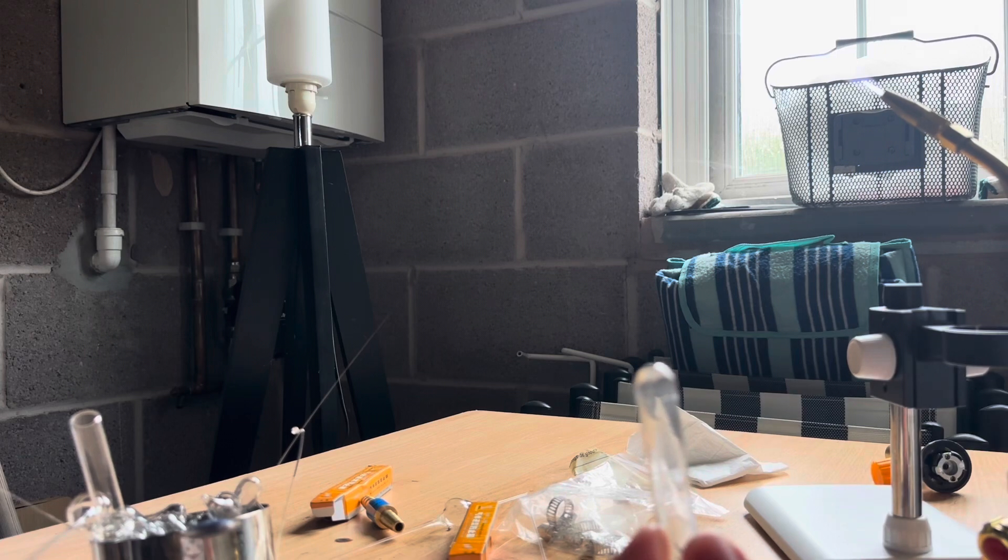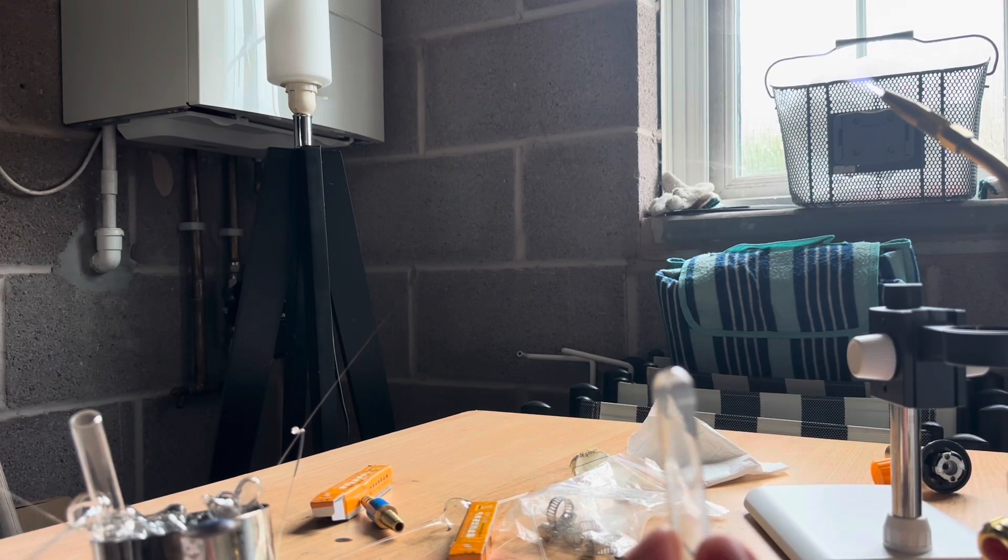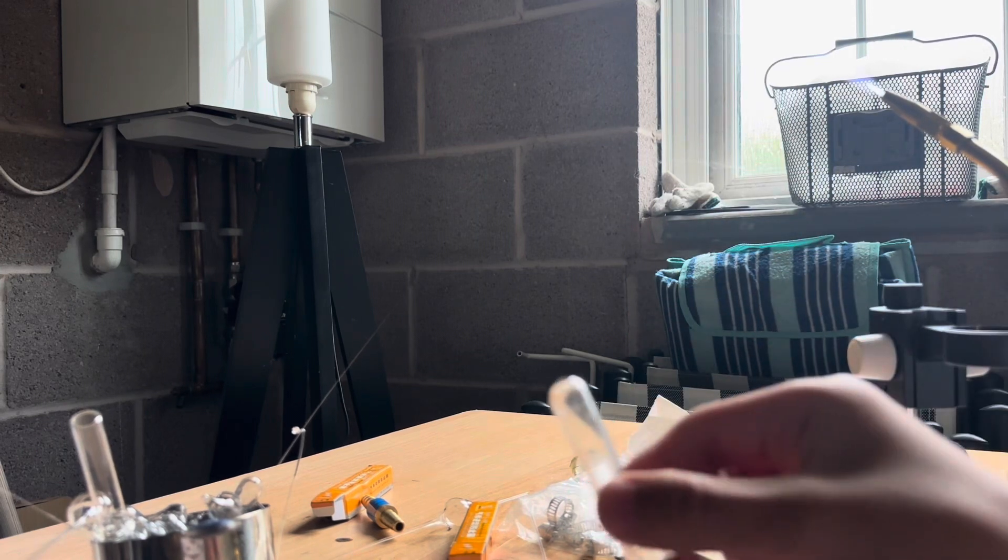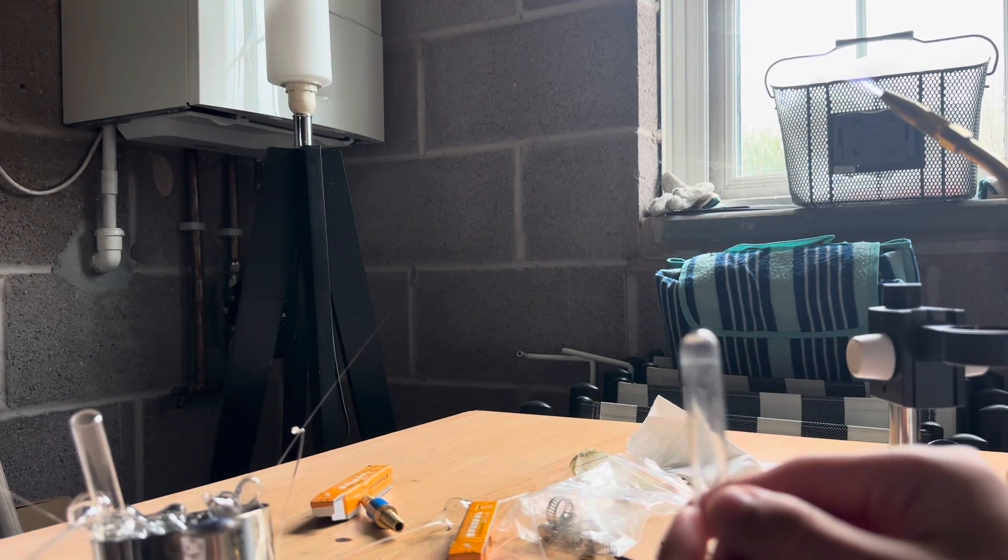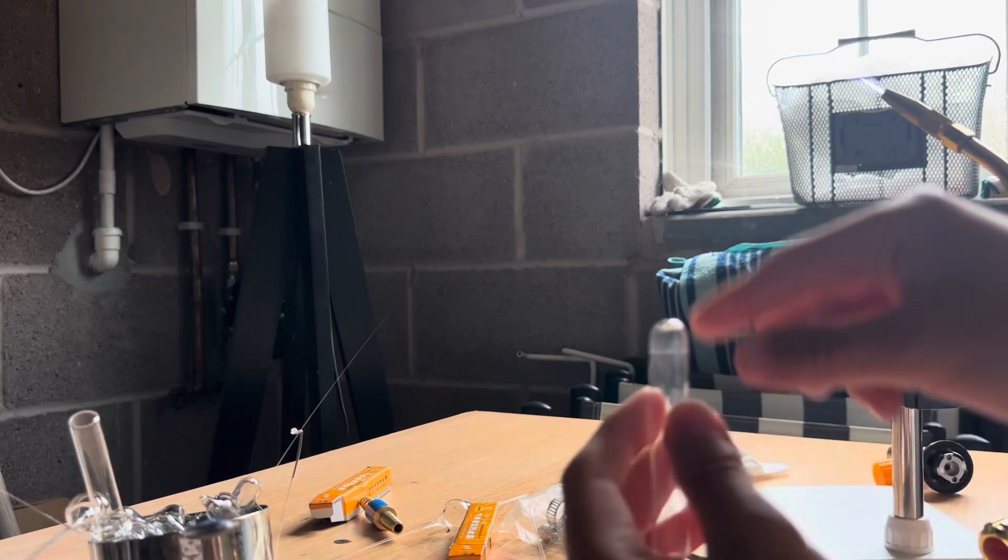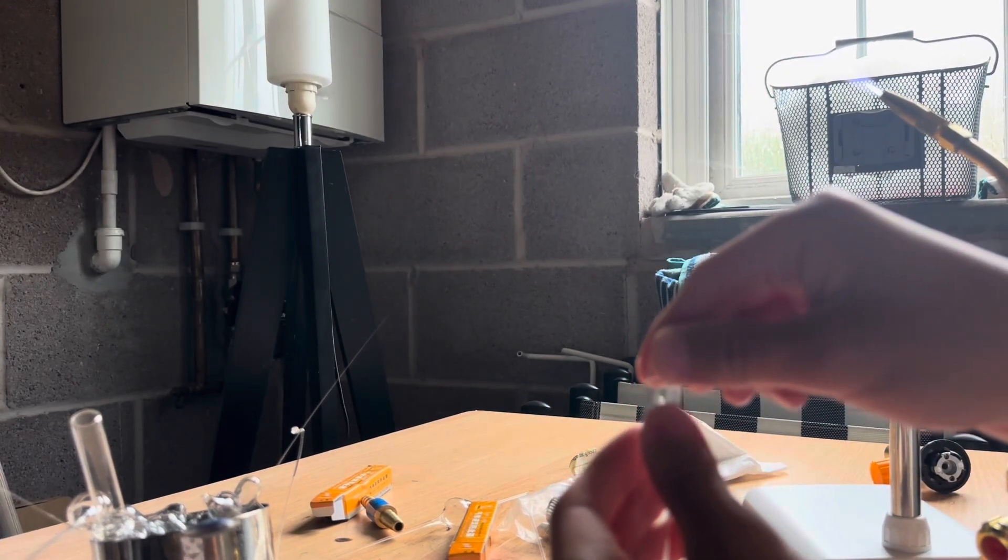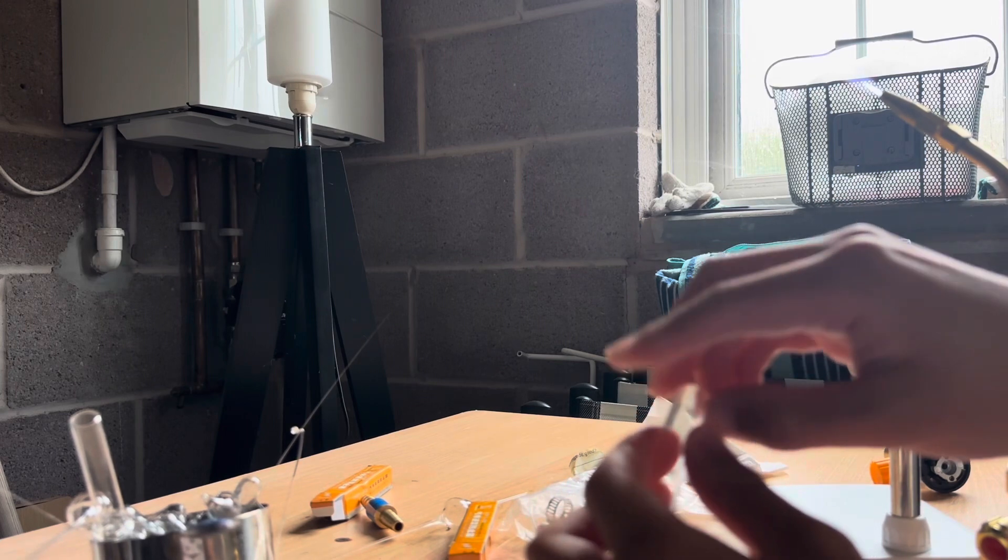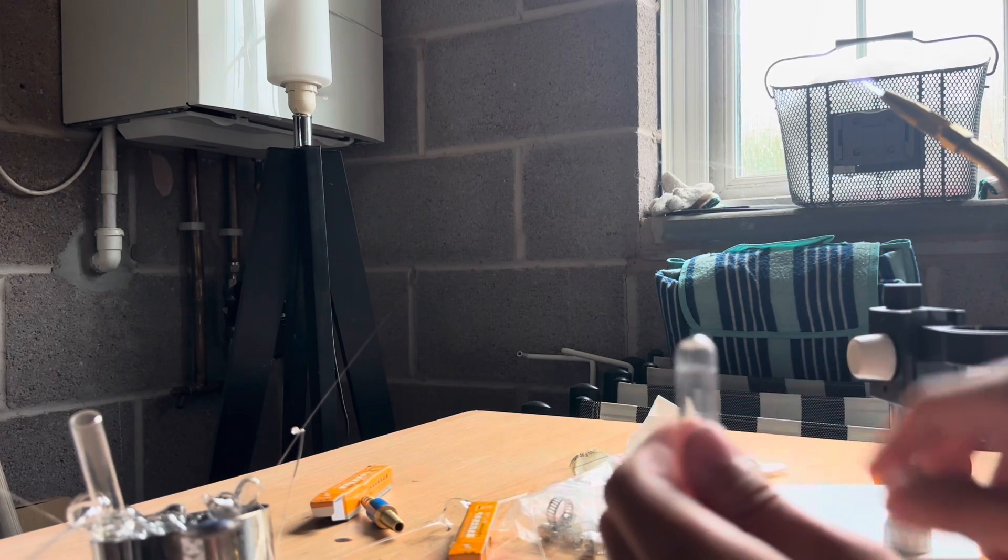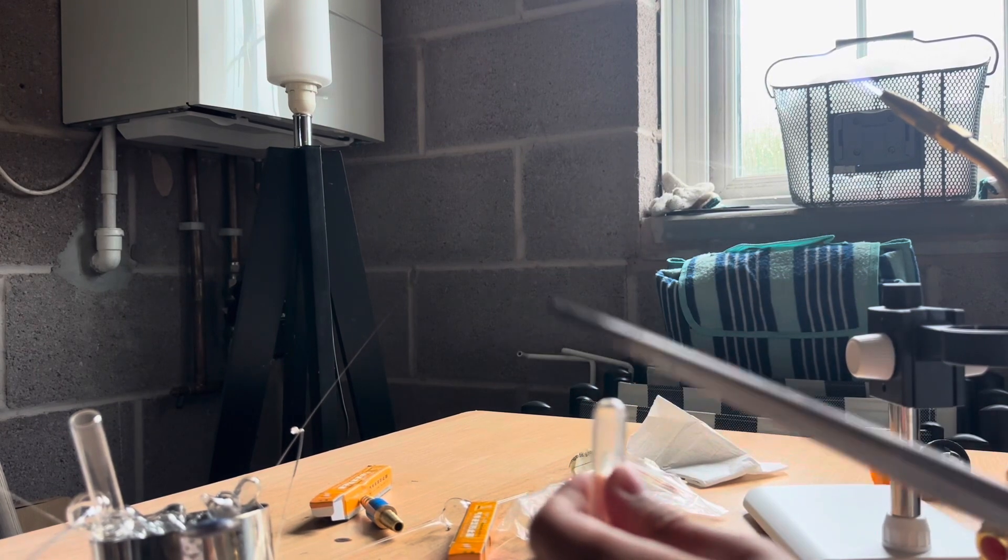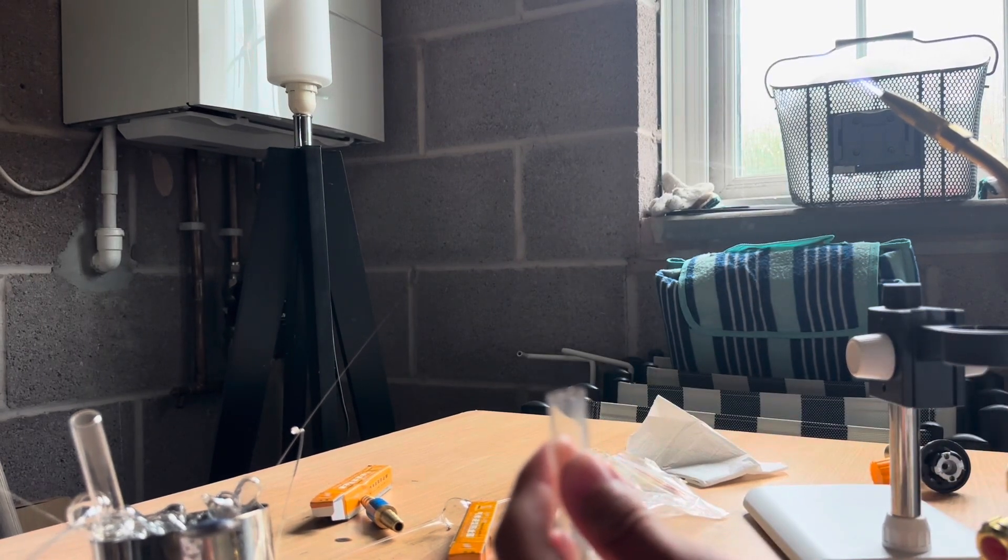Break the glass off on the section that hasn't been scored as you put your thumb over there. The glass can still remain some heat due to the heat transferred onto the glass by the hot glass rod. Just like this. You can feel the glass is about to coming off. If not, you can knock it slightly with another tweezer or something. Here, we have a perfect break.